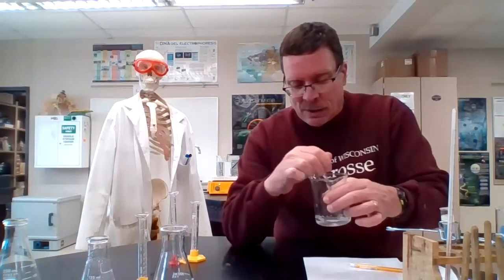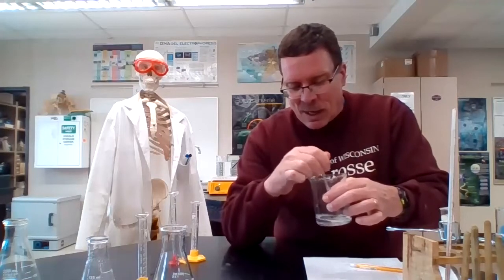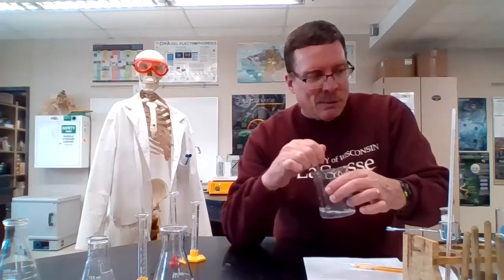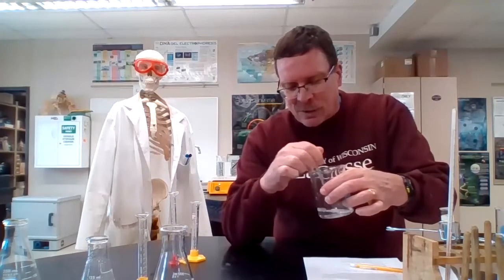And again, this is day two of exciting, thrilling stuff for you, where you get to watch me stir until the color changes. If I have done this right, and if it follows what I did in a little testing before we started filming, we want to be around a minute, maybe a little over. If you think of what we've learned already, as we go to the higher temperatures, the reaction should go faster. And we want to have some time for the reaction to have that ability to change.